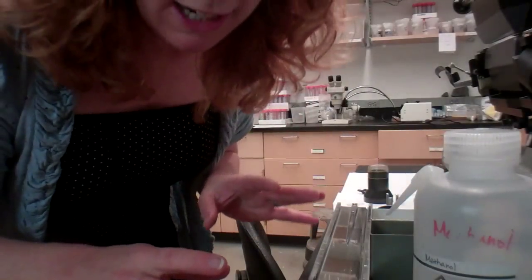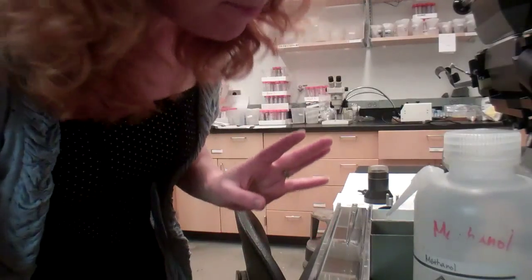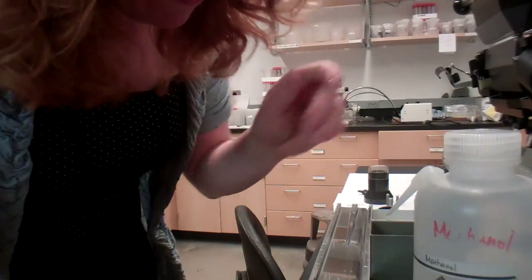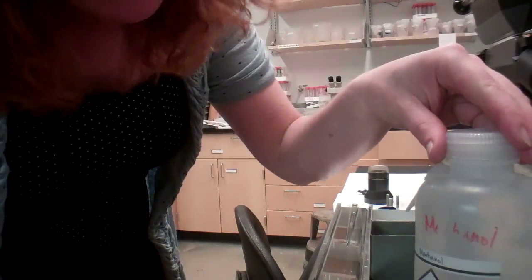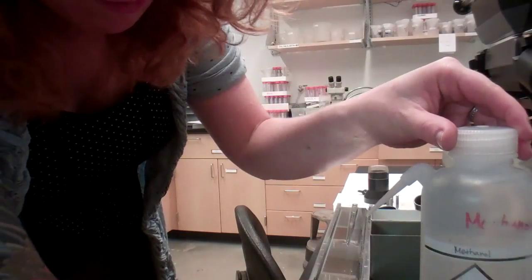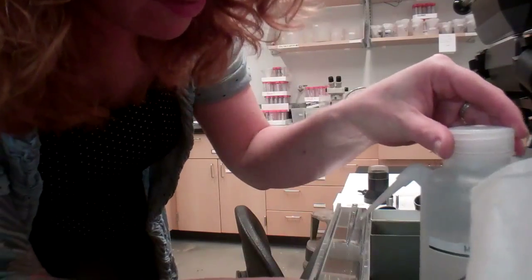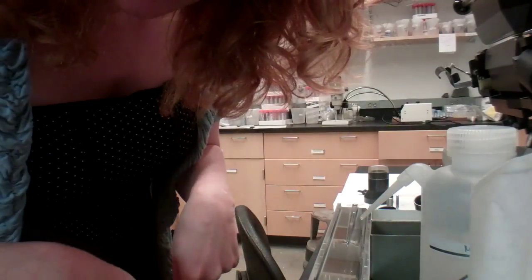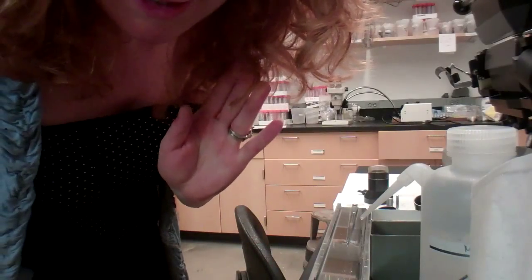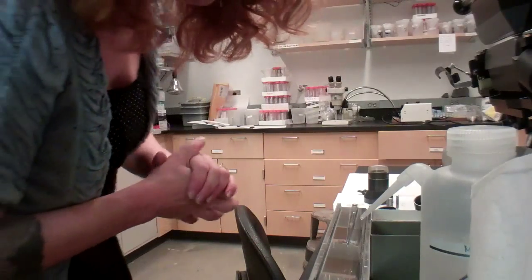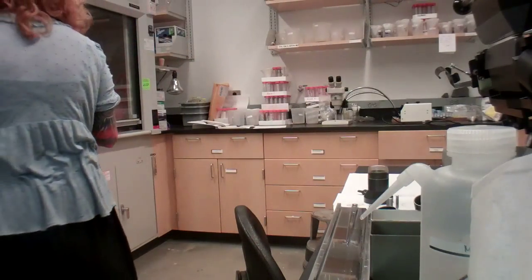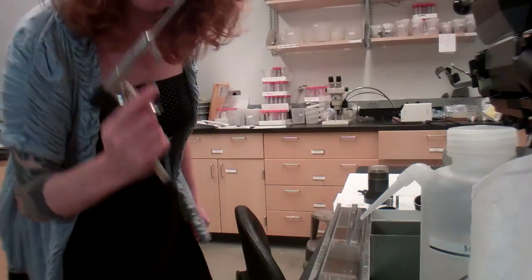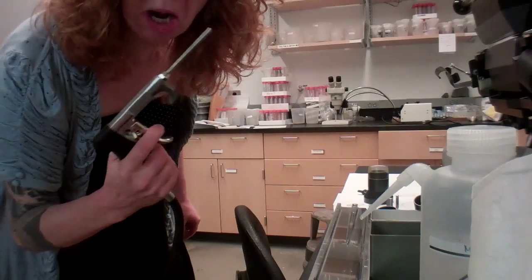I'm cleaning up Franz. He's been very dirty. And just so you know, this is how we clean in the lab. We use methanol and kim wipes. We wipe everything down and then we air gun them. So I save the air gunning for last because it's so fun.